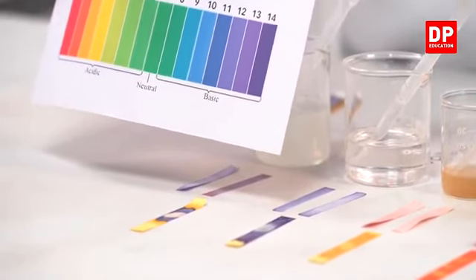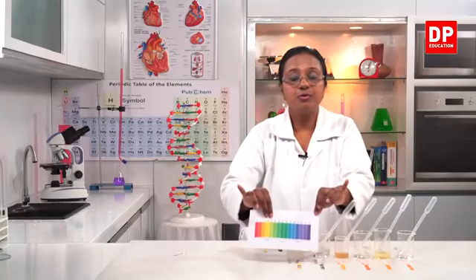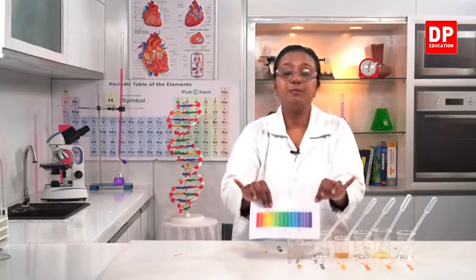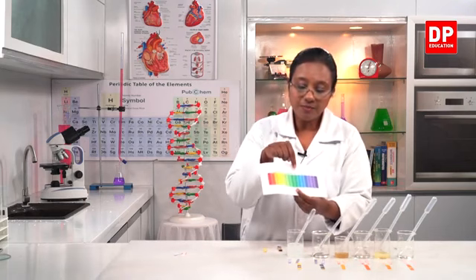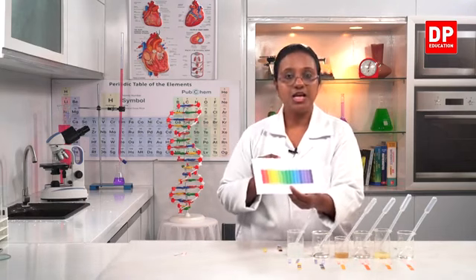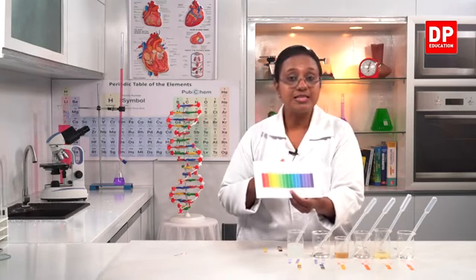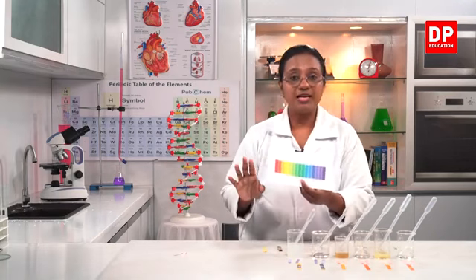So it's weaker than sodium hydroxide. Although we use sodium hydroxide for the production of soap, but as soap the pH is less. So here going from 8 to 14 it is the basic pH, and when you go from 8 to 14 the basicity increases. You all can observe that clearly.